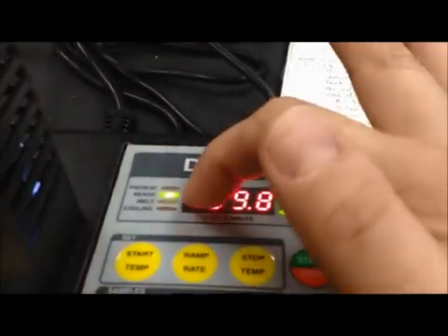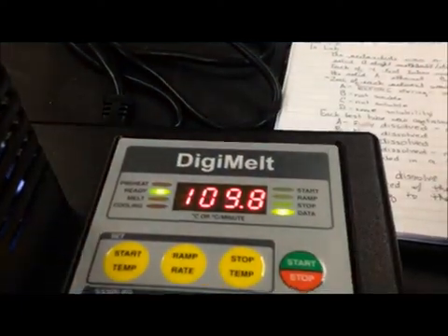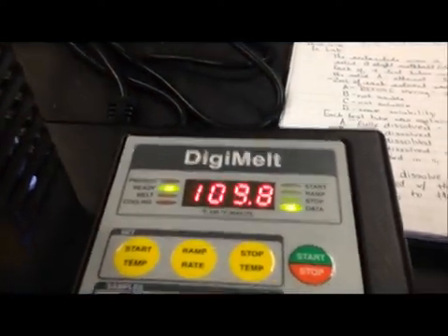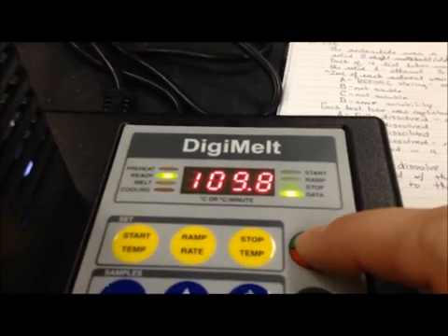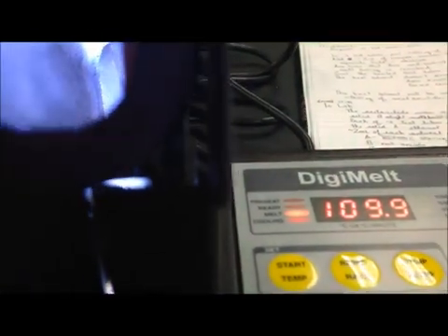When I'm all ready to go this light right here that says ready will be in green and that means I'm ready to go. So I'm going to hit the start button and you'll see that the temperature will start to rise. Then I'm going to come over here and watch through my viewfinder what is happening with my crystals. So I zoom in here, nothing really is happening. My temperature is at 109.